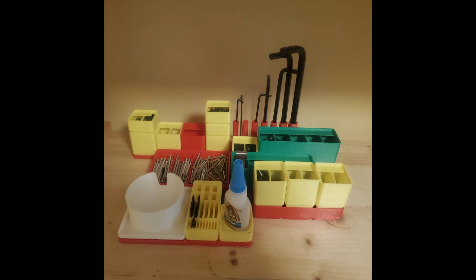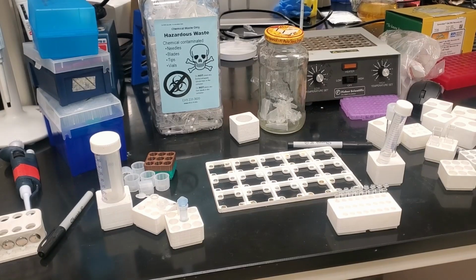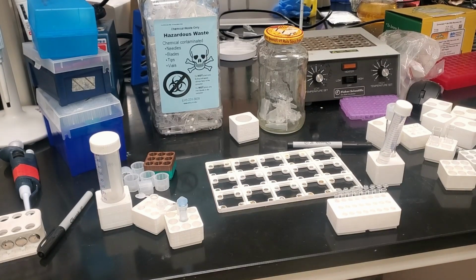So that way we can hold anything from longer screws to Allen wrenches to that one specific set of feeler gauges that I lost the screw to and fixed with a thumb screw because it was the only thing within reach. Again, Gridfinity is not my idea, but since it has become a very large project, allow me to show my contribution. So here we are with the modular tube rack.